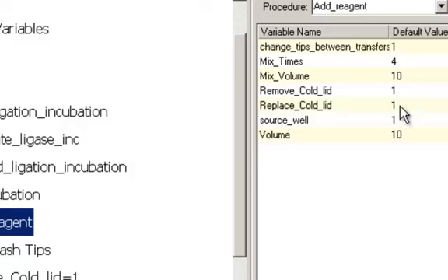And when you end this procedure, do you want it to place the lid back on the cold block? And then we got the source well. The source well tells it what well in the cold block is our source. In the Biomek, the top left is well 1, the bottom right is well 24 in our cold block because it's 6 by 4. And here is the volume we're going to transfer.